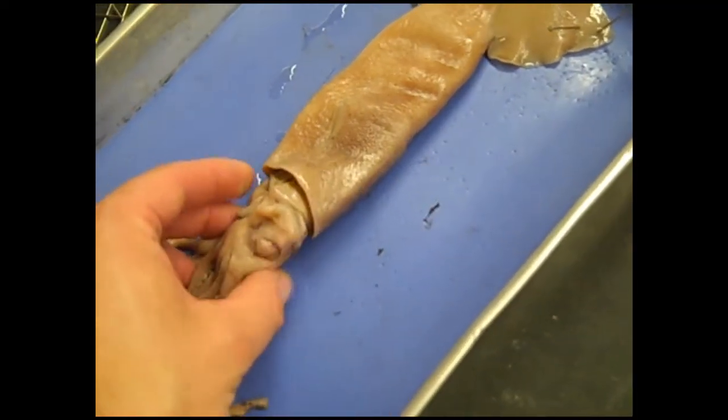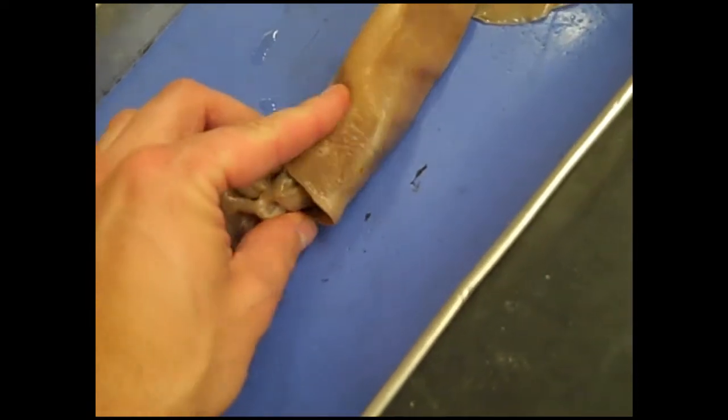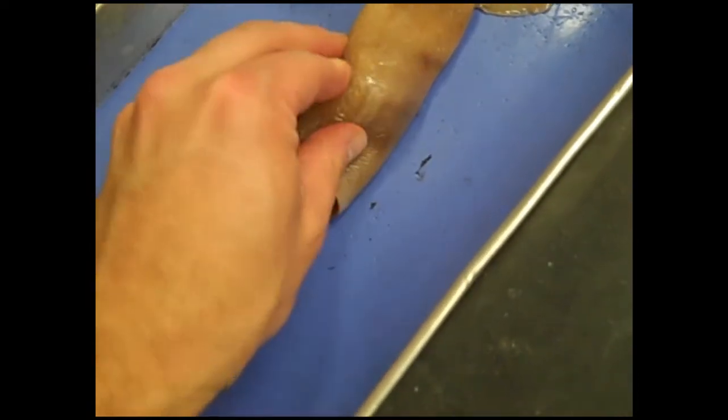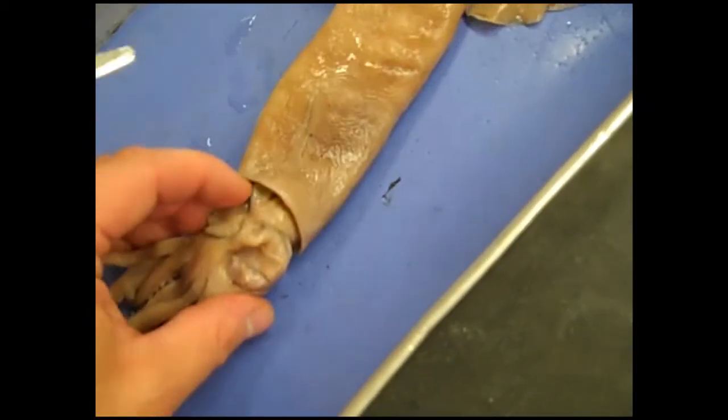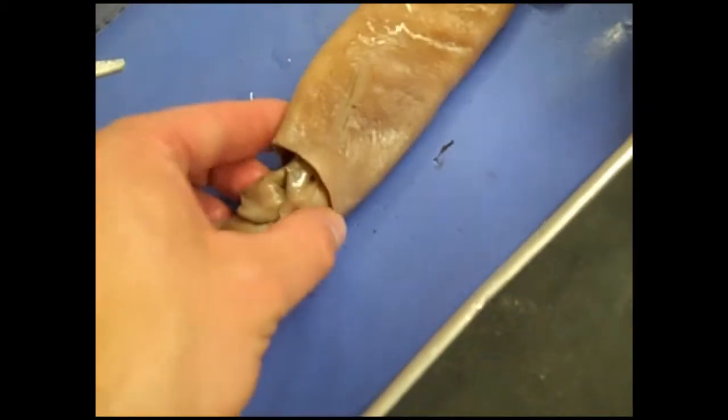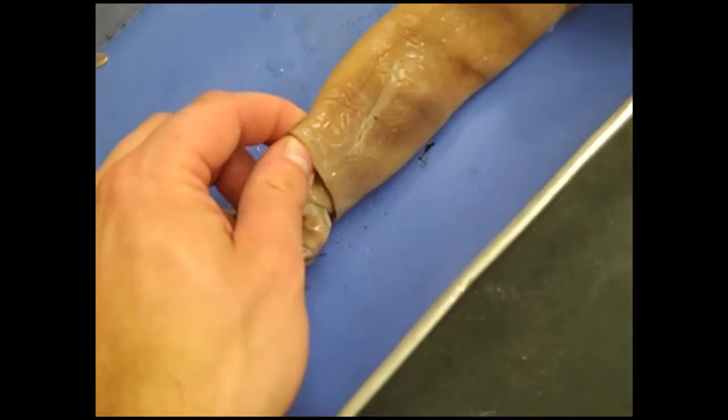Your squid here is upside down. You want to get the, oh well, it's kind of twisted. You want the funnel here. You want this part right here like this so yours is kind of matched to the side. You did a good job having the funnel up pen down but yours is kind of twisted here. You don't want to pin it just yet. It's gonna take two hands.